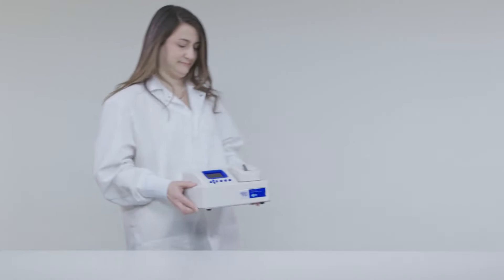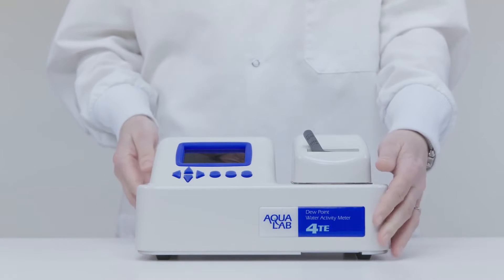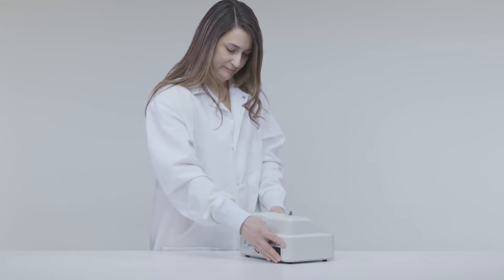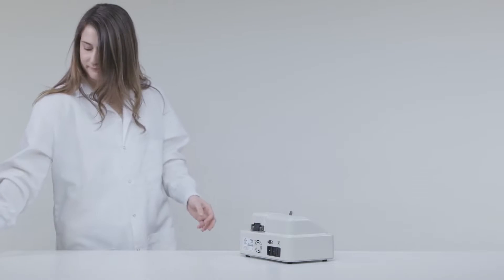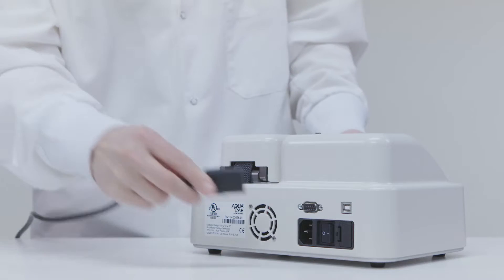Select a clean, level place that has a relatively stable temperature. Small temperature changes won't affect your Aqualab's performance, but it shouldn't be located near heating or air conditioning vents.